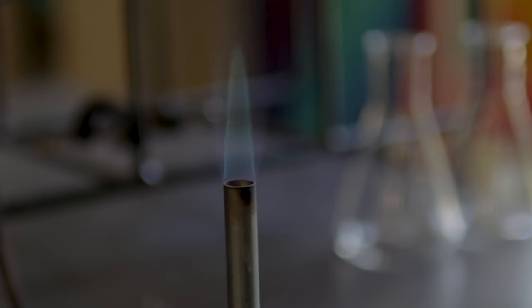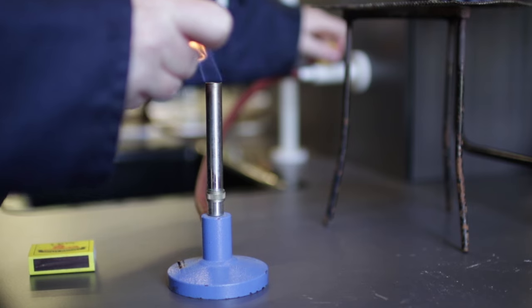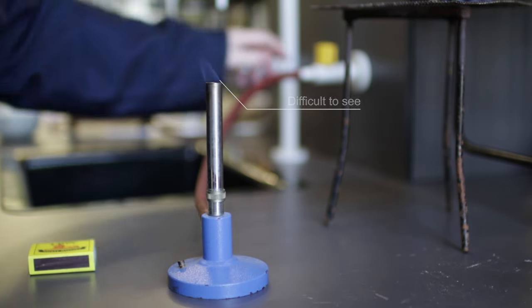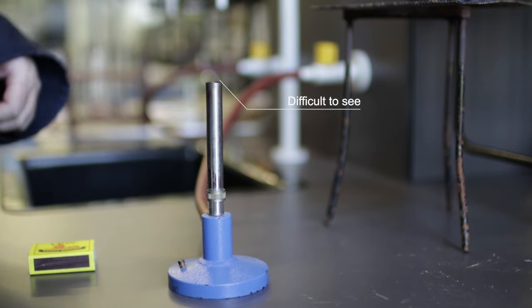This flame is difficult to see so you should never light the Bunsen burner with the air hole open or it may not sufficiently ignite which results in a safety risk.